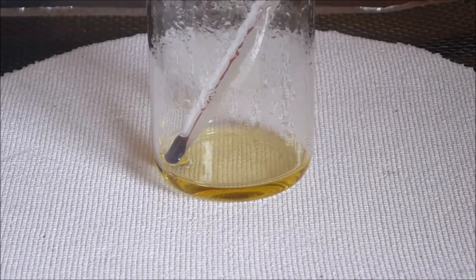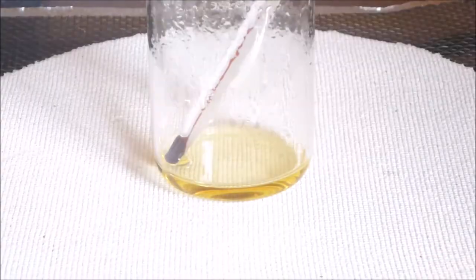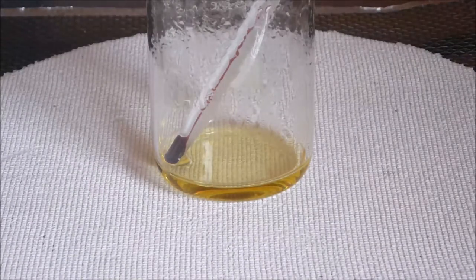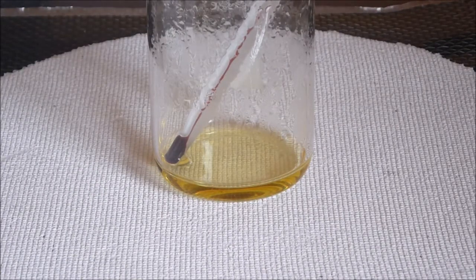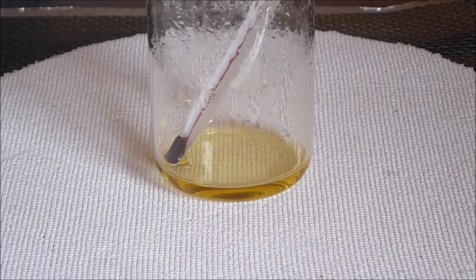Okay, I think that's pretty much done the business. The next step is going to be a test with stannous chloride and we are looking for a nice blue reaction. So I'll just get a little bit of that into a spoon, put the drop on and we'll have a look at it.